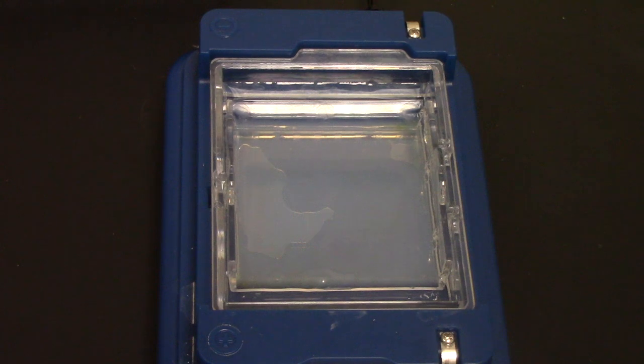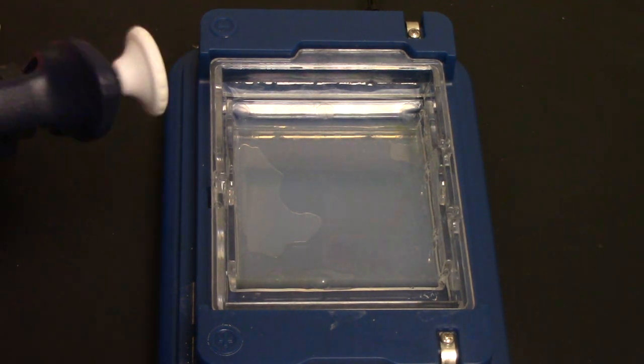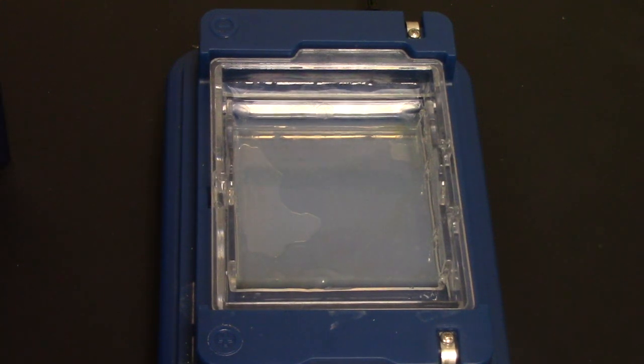Now I'm going to start adding in my samples. The first thing I'm going to add is my ladder, so I am going to set my pipette to how much I need.